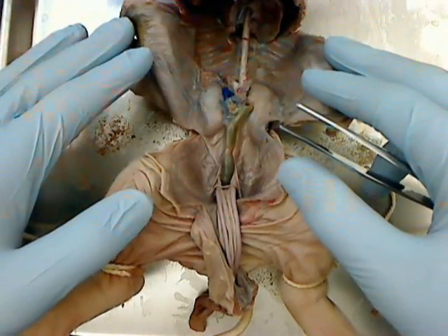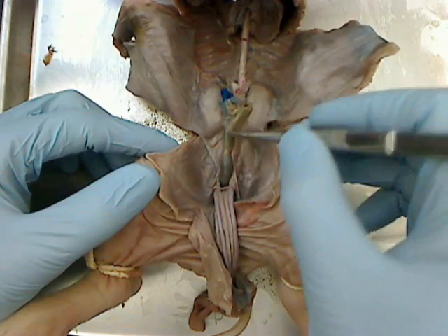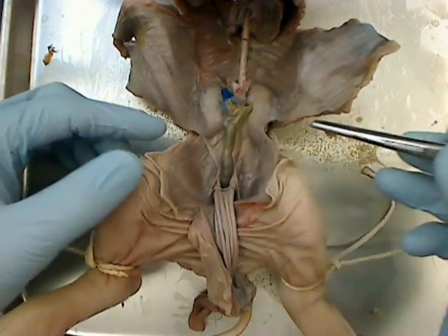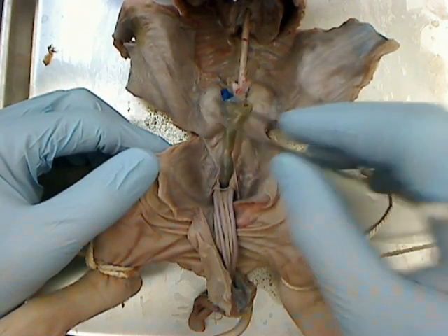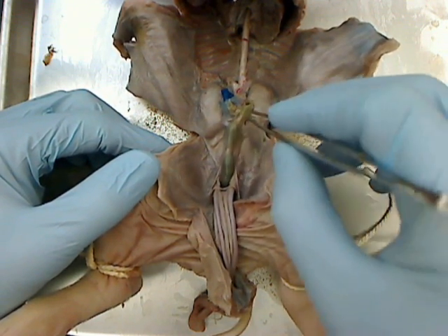I'm going to take a break and dissect out the digestive organs and open up the fetal pig. Already dissected open, I've removed all of the digestive organs, except for this piece of the large intestine coming down, which at this point you might call the rectum. For the urinary system, this organ over here is the left kidney, and this organ over here is the right kidney. I will start removing some of the peritoneum.